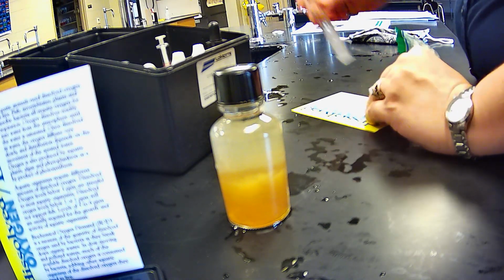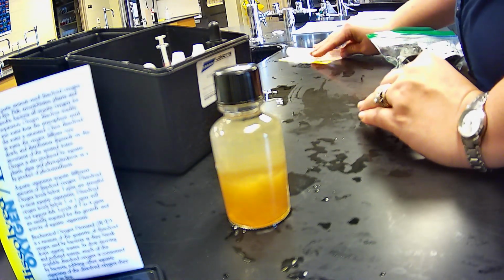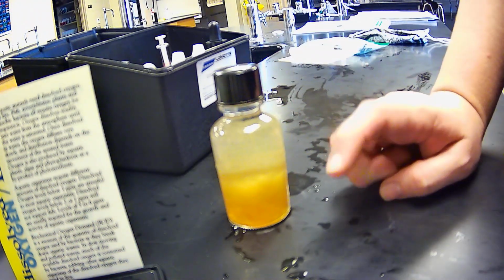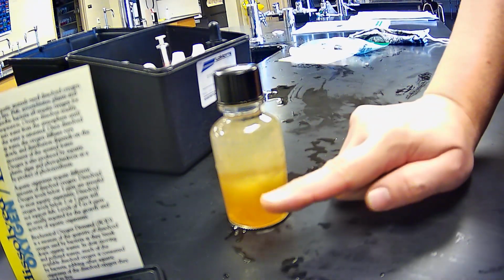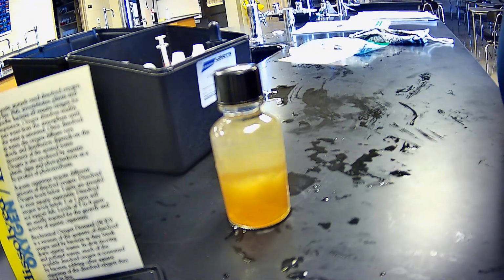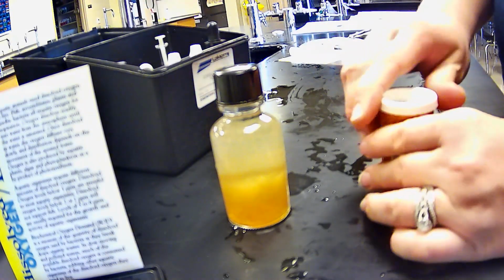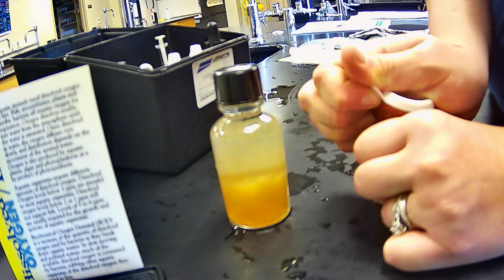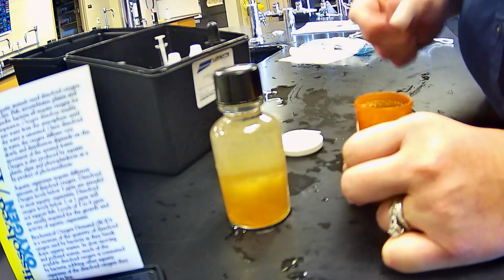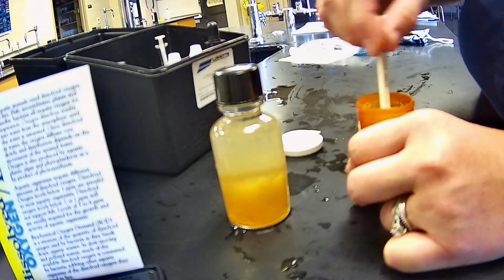All right, looks like our DO over here is coming along very well. This hasn't precipitated enough yet. That needs to get down just a little bit lower. And I know that this piece will come next. These things are kind of corrosive, so just be careful. But I need a gram of this.